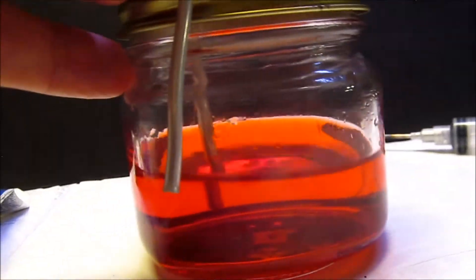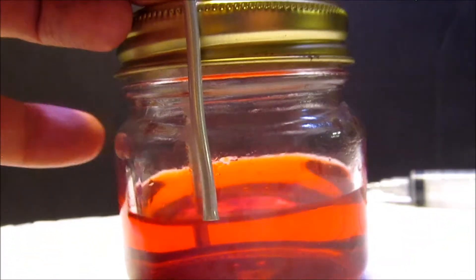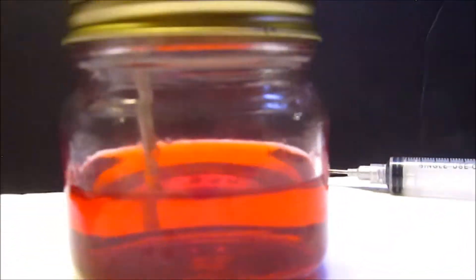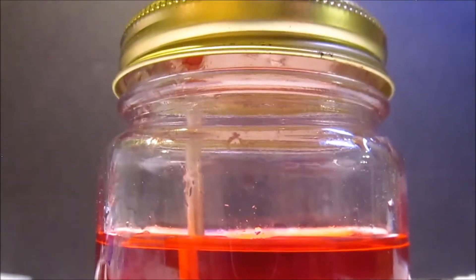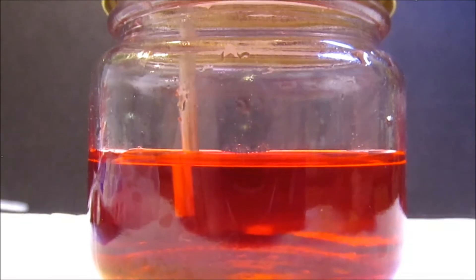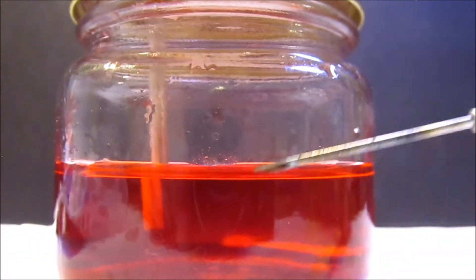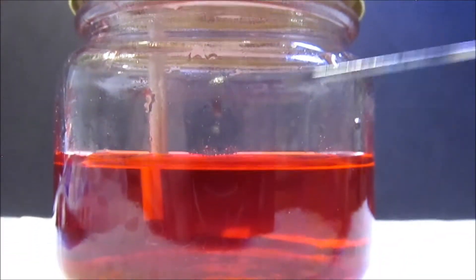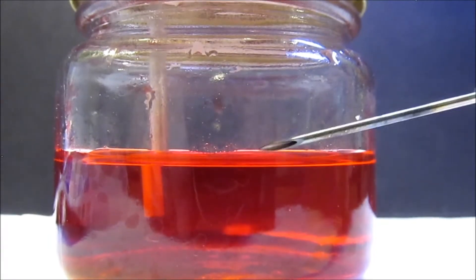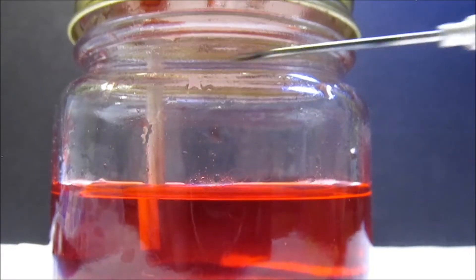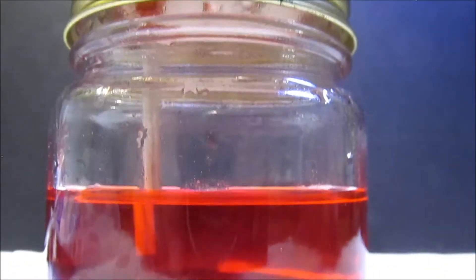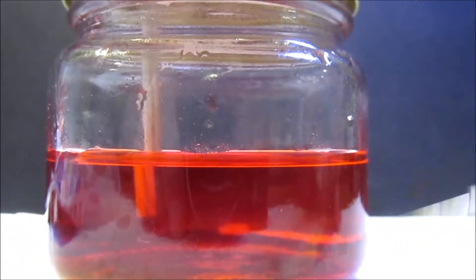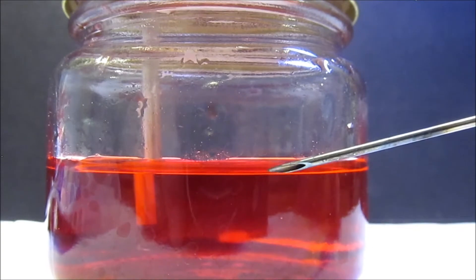Because what normally happens is, without the tubing, we have a jar with the liquid culture in there. I've got it red for the sake of photography here. Now, since we have to allow room for the liquid culture to expand while it's being pressure cooked—it's going to boil—you don't want it to touch the top, leak out, or touch your filter material. So you can only fill a liquid culture jar to half its capacity.